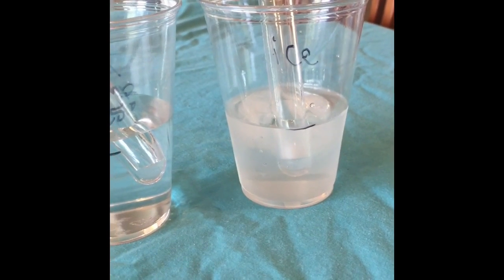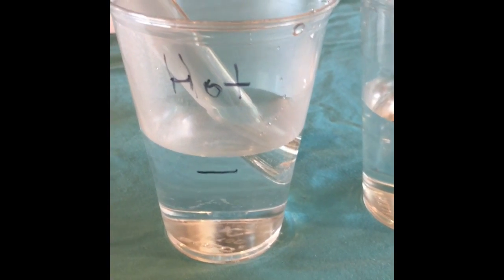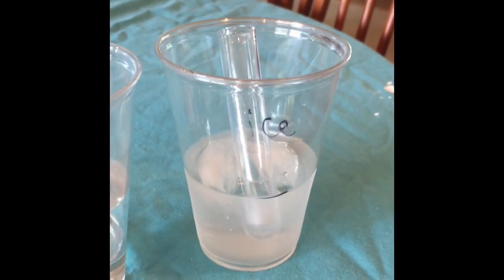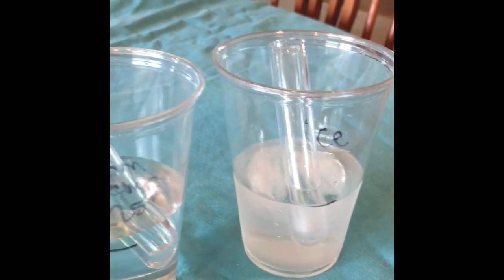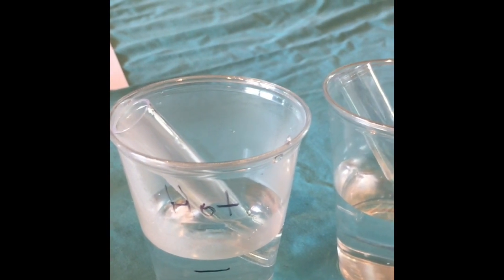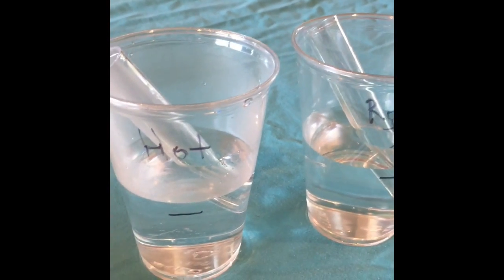Okay, so I have added the starch solution, hydrochloric acid, the sodium thiosulfate, and potassium iodide concentrations to each of the test tubes and placed them in an ice water bath, a room temperature water bath, and a hot water bath. The hot water bath is 53 degrees Celsius, the room temperature bath is 25 degrees Celsius, and the cold water bath is 4 degrees Celsius. So they will be sitting here for 5 minutes, and then I will add the hydrogen peroxide to see the reaction rates from the temperature change.